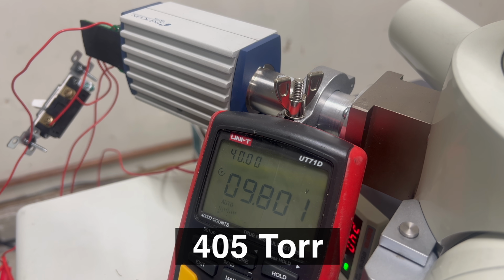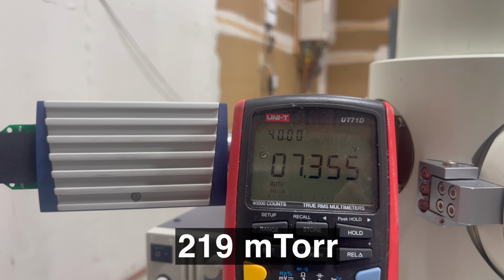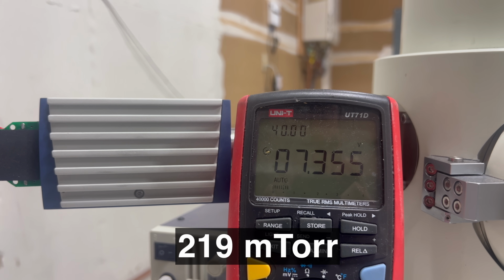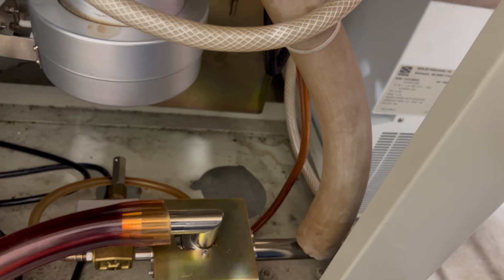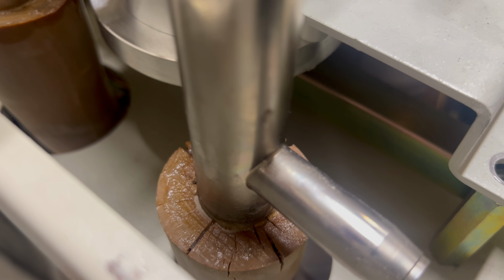So I turned on the rotary pump again, and now I can definitely see the pressure in the chamber dropping. That's a good sign. However, after leaving the system running for several minutes, I saw that the pressure bottomed out at only 200 millitorr. We saw earlier that the pump could do 10 millitorr, so this definitely indicates a leak somewhere in the system.